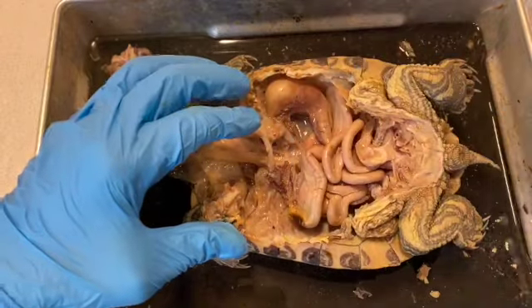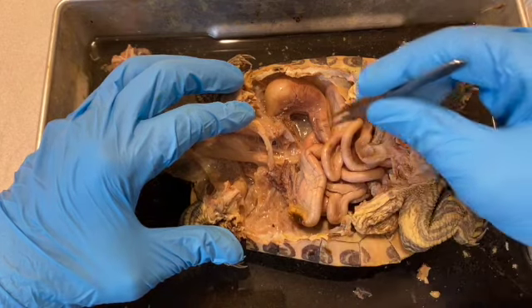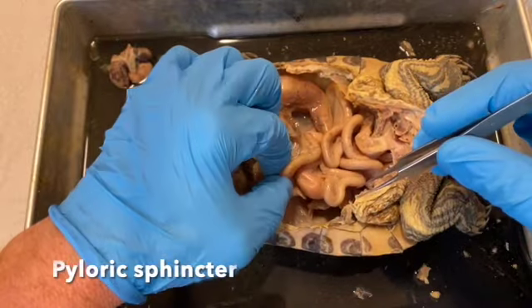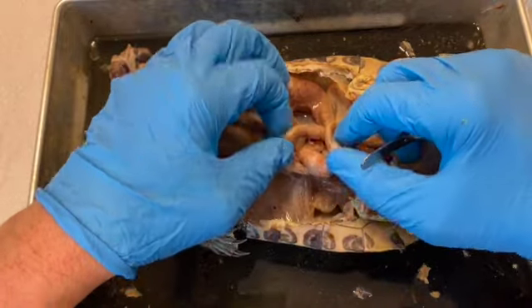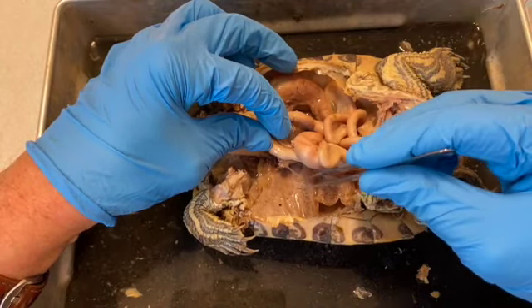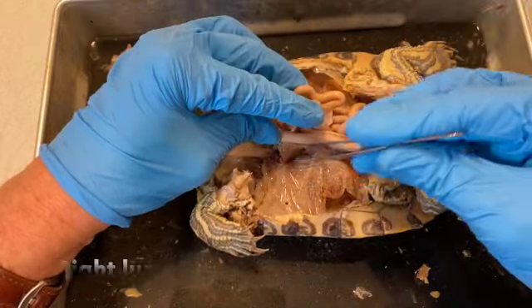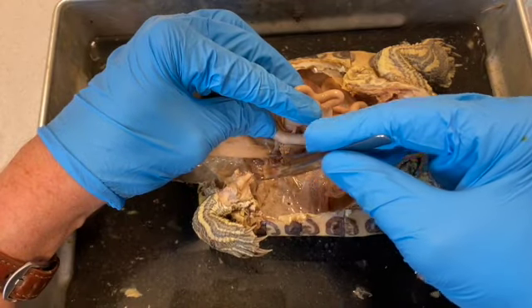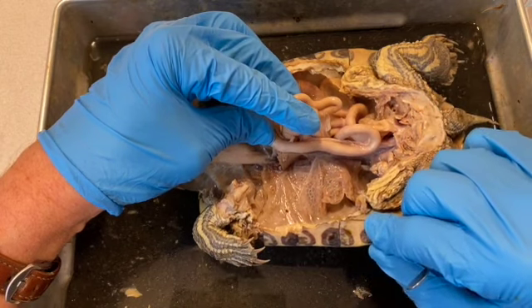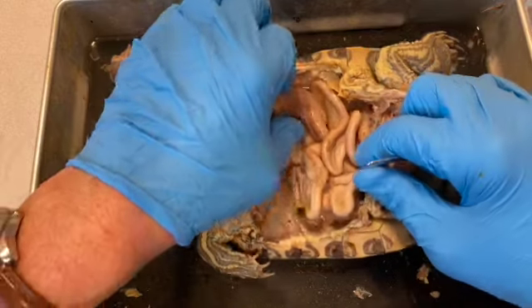If we now take the small intestine, here we have, actually, the stomach extends all the way, this J shape, until it turns the corner up here where the pyloric sphincter is. But if we roll this over to the side like so, this kind of mesh pattern material in here is the lung. And so this is the right lung that extends from all the way up here, all the way down here along the dorsal wall of the body cavity. And there, of course, is a left lung underneath the organs on the other side of the body as well.